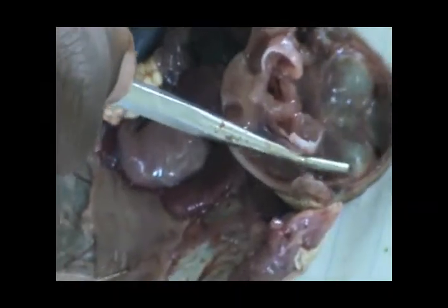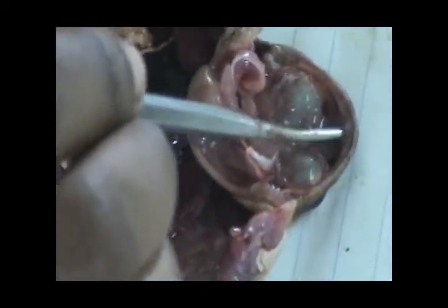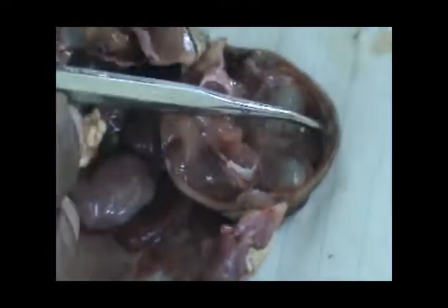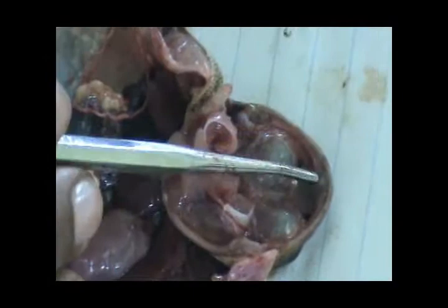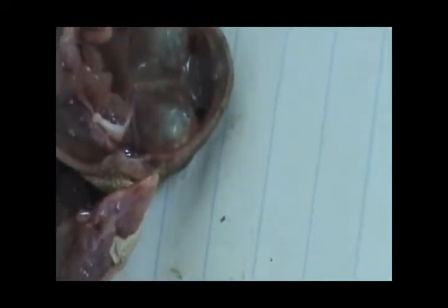This lining inside — toads and frogs really don't have teeth — but this lining inside shows you the existence of the maxillary teeth, the ones they use to feed. When we reach up here, we have the internal naris. And down here, almost close to the eye orbital, it has vomerian teeth. So the vomerian teeth are immediately after the eye orbital, then the internal naris, and then the existence of the maxillary teeth.